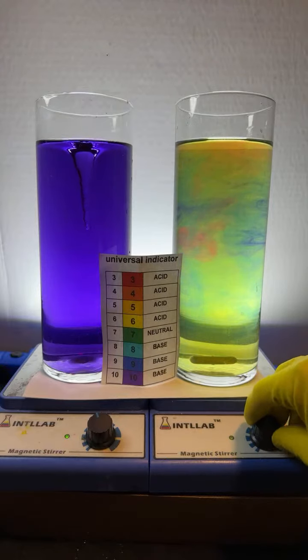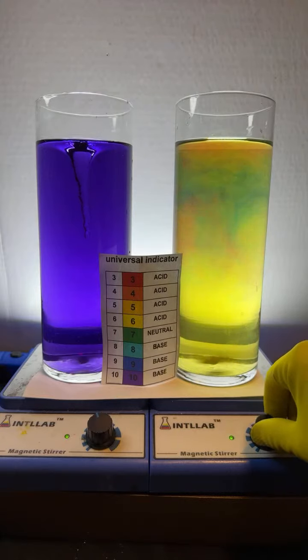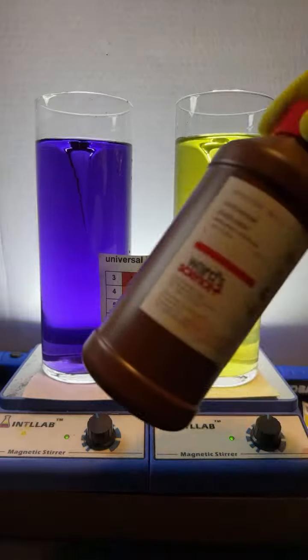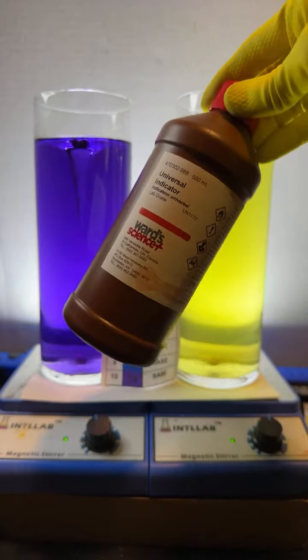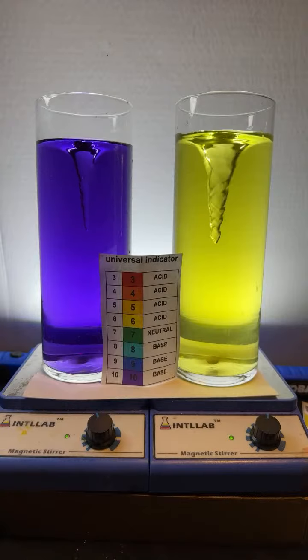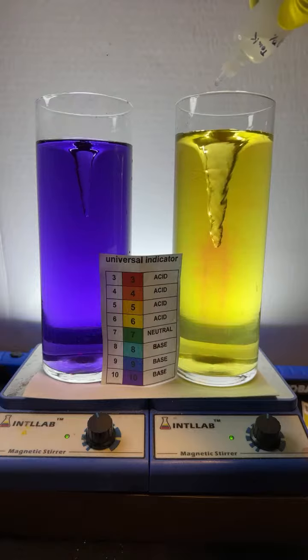You're a high school chem teacher. Are you using phenolphthalein as the indicator? I am using universal indicator. If you don't have some of this, you should really get some. You can see I got it here from Ward Scientific, and you can also buy it from Flinn Scientific. In my opinion, every chemistry teacher should have some universal indicator. There's a wide variety of experiments you can do with that.